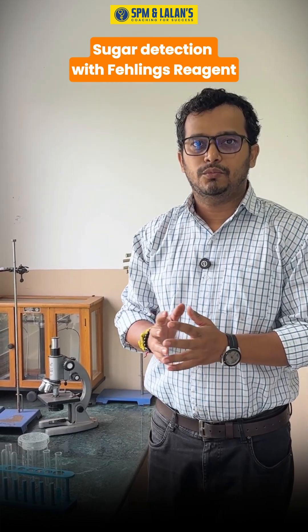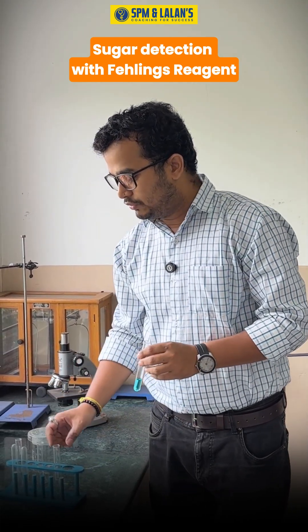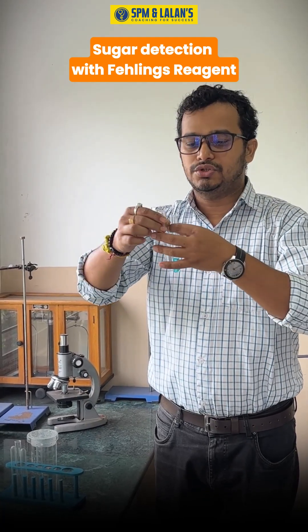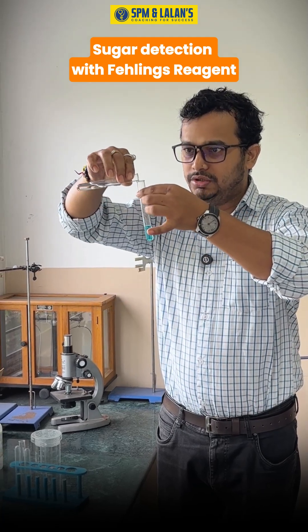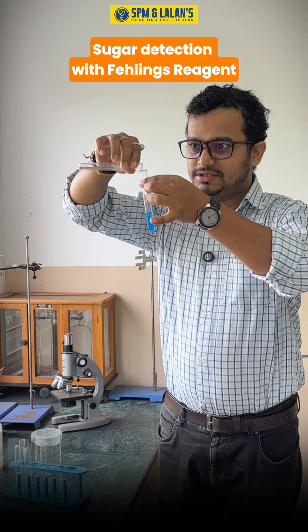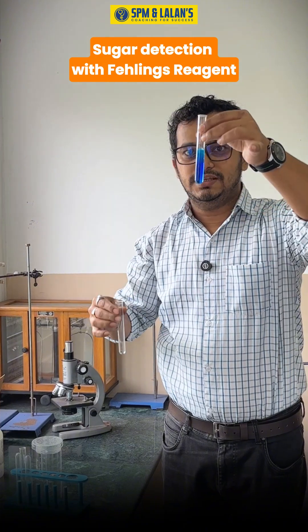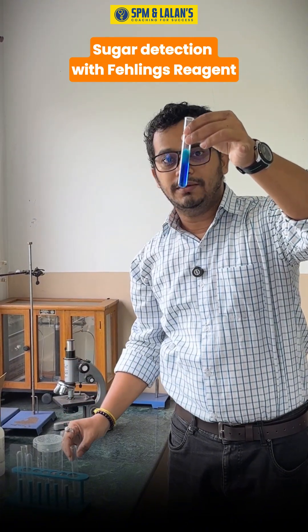Hello students, today we will perform one important experiment: the determination of sugar with the help of Fehling's solution. Here we have Fehling's solution A and Fehling's solution B. When we mix both solutions, you can see there is a change from light to dark blue — a change in the color of the Fehling's solution.